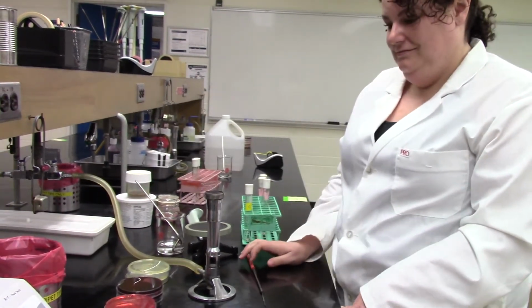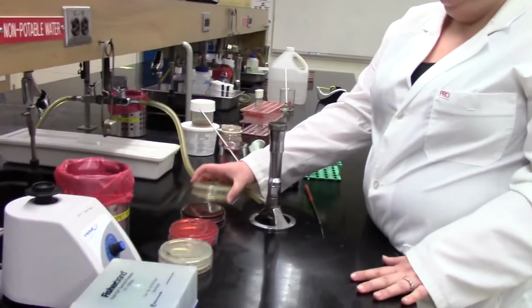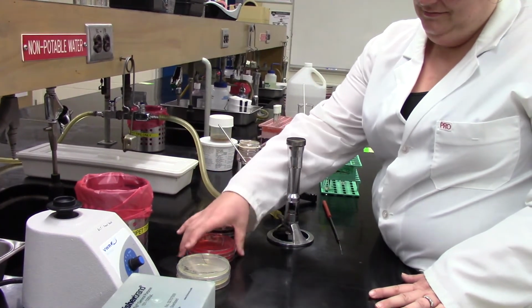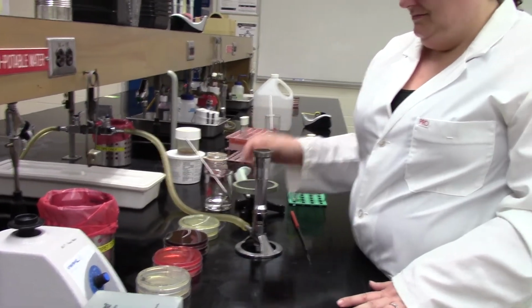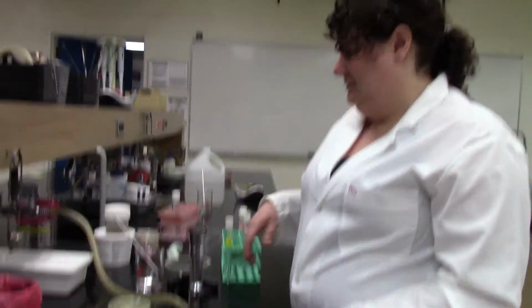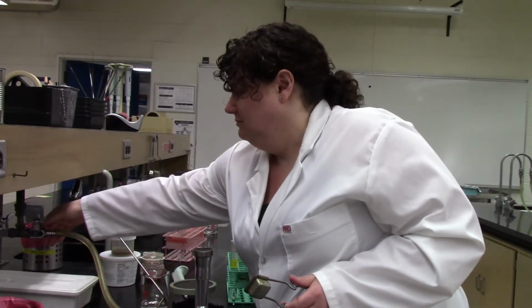So we're going to be spread plating these onto some selective and differential media, that colorful media that you've seen in lecture slides. We're going to look at some supportive media at the end there. And actually, you know what, before that I'll talk through those as Sabrina gets to work on doing some known bacteria on those selective and differential media plates.